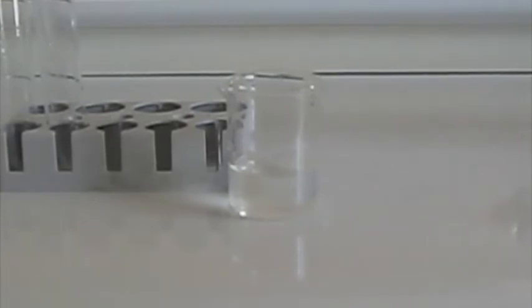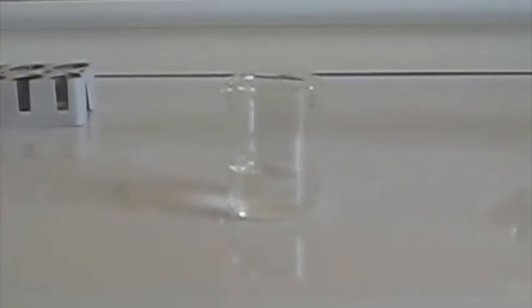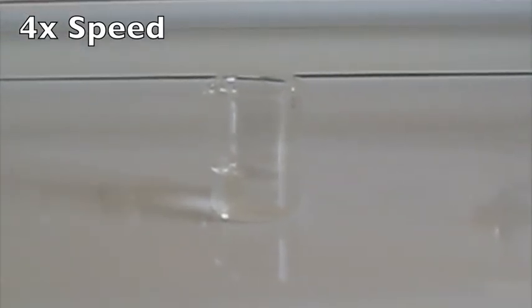The method I'm using to perform my iodine clock reaction gives a result that's not as amazing or cool as other iodine clock reactions. Where mine, instead of all of a sudden becoming black, sort of starts to become black very slowly, but still a clock reaction.